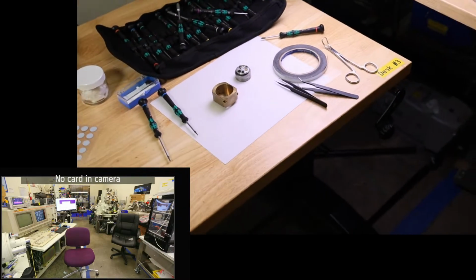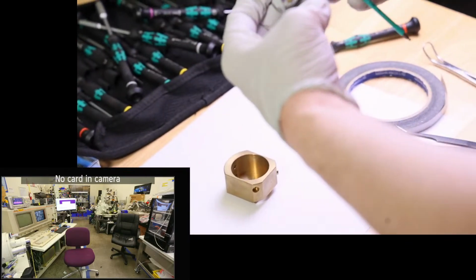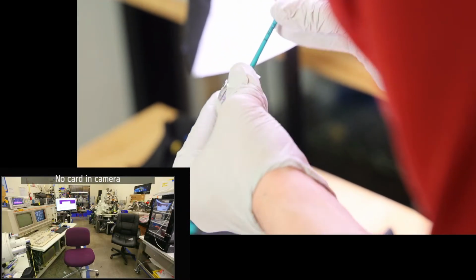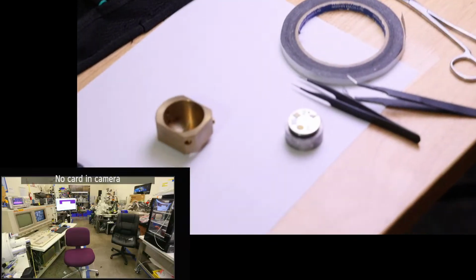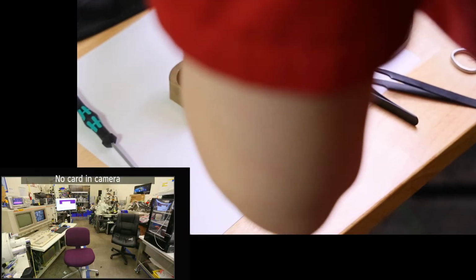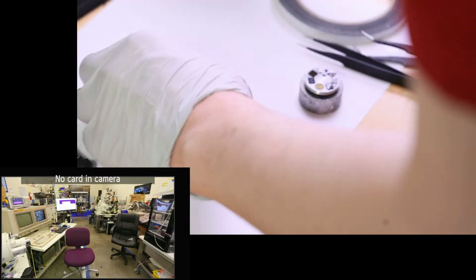Okay, we've retrieved the Allen keys, and we got the 2mm key. Now we can free it. No, it is smaller than 2. Okay, it's the 1.5. Oh, I used the 1.3 and the 2. I didn't use the 1.5. That's probably why. Is 1.5 in here right now? There's the 0.9, there's the 2, there's the 1.3. Yes, the 1.5 is not in the kit. Okay.